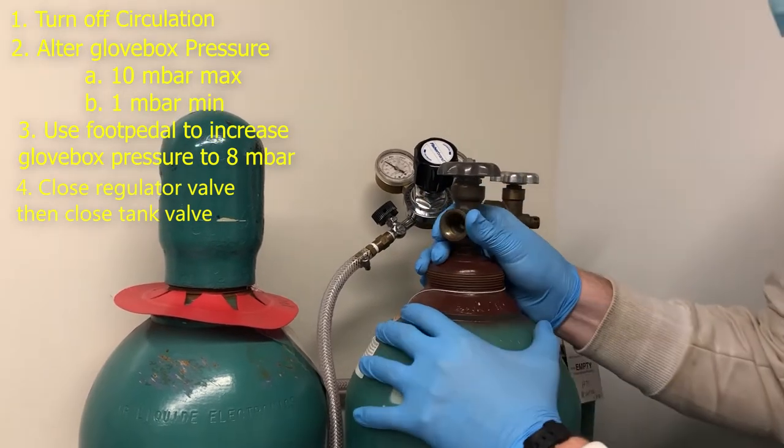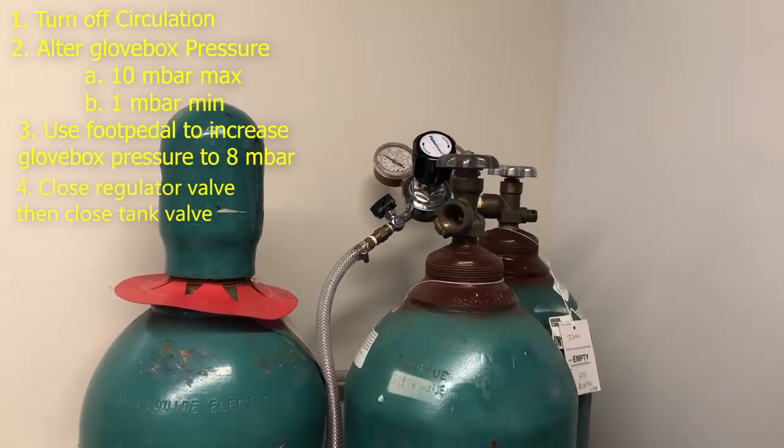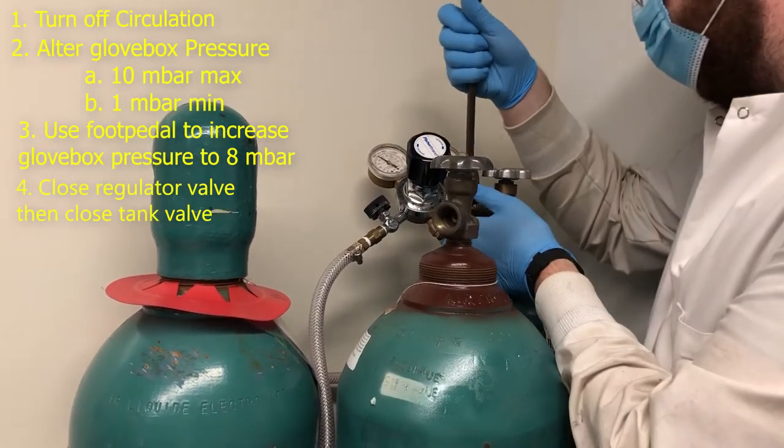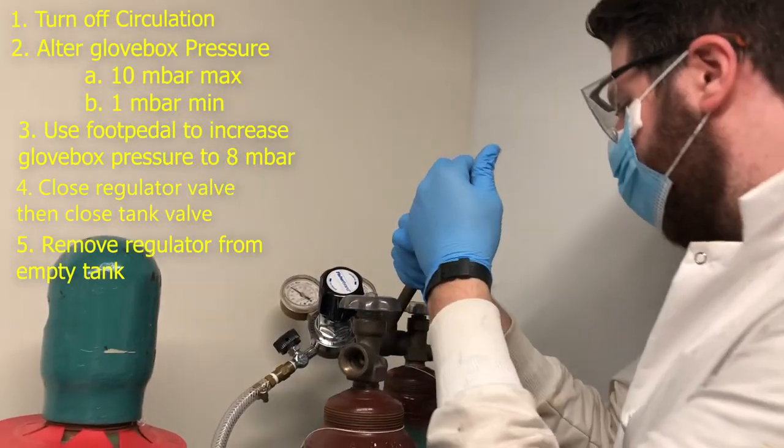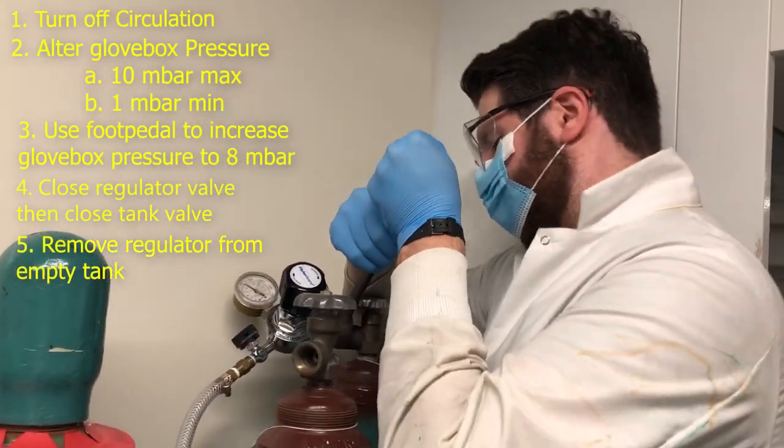Alright so we're using Ultra High Pure Argon, which is pretty expensive sometimes. I don't know what it is. But then you want to go ahead and loosen.